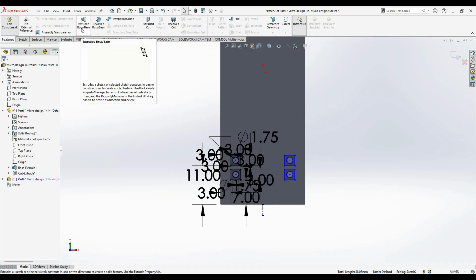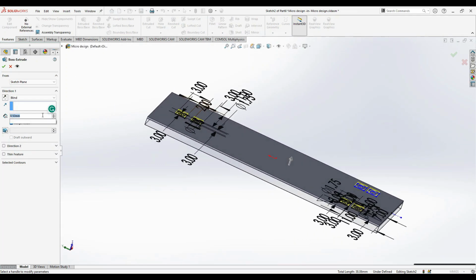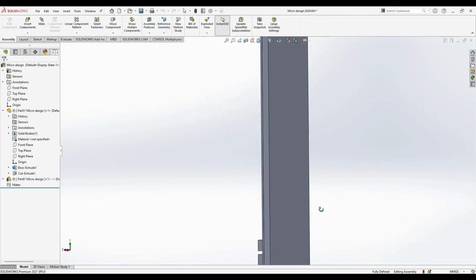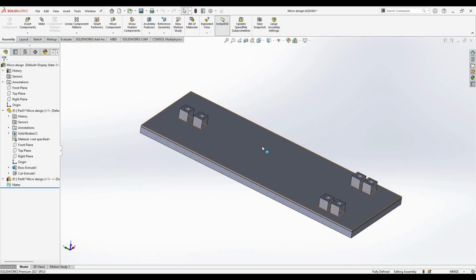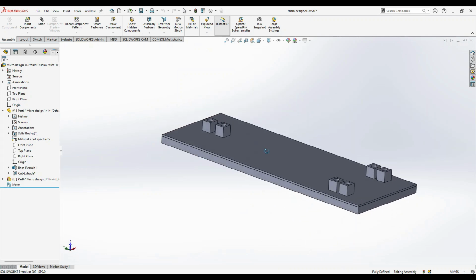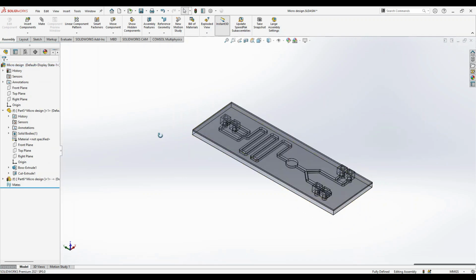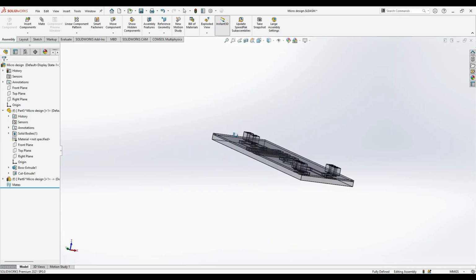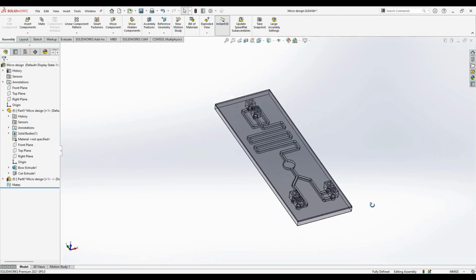Go to features and then you can just extrude. Extrude this by 3 mm. So you can see the inlets. You can use your complete channel for 3D printing of microfluidic channels, or you can use the same for your PDMS-based photolithography microfluidic channels. If you want to see the transparent view, you can see the transparent view. So this is how you completely define a microfluidic channel for 3D printing as well as for lithography. Thank you for your patience.